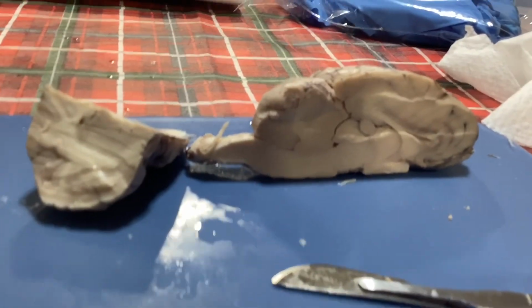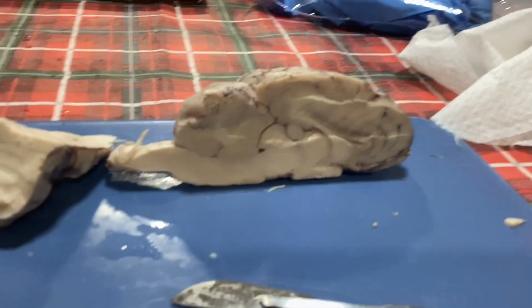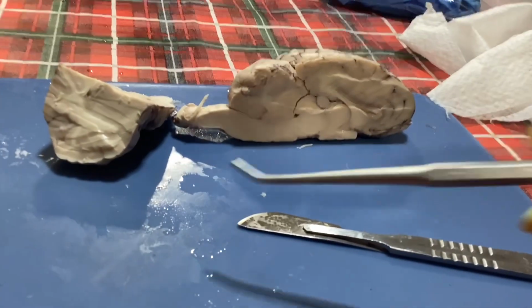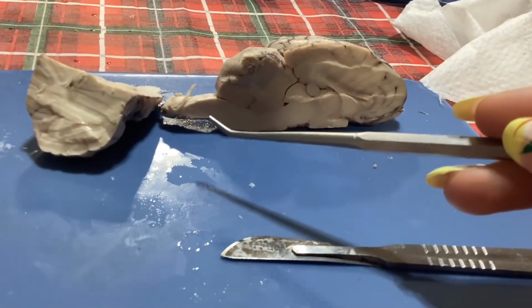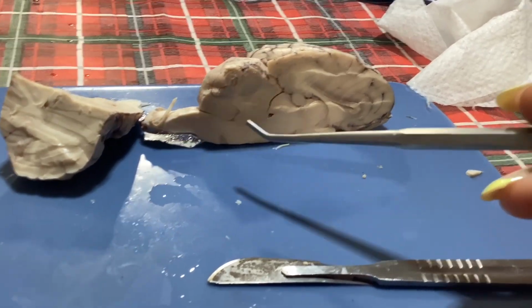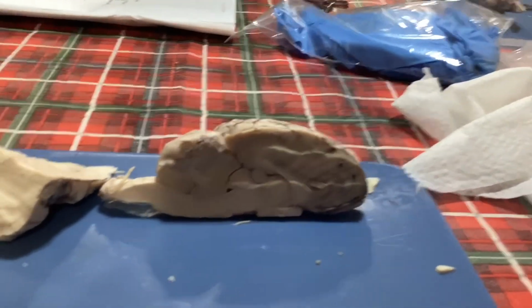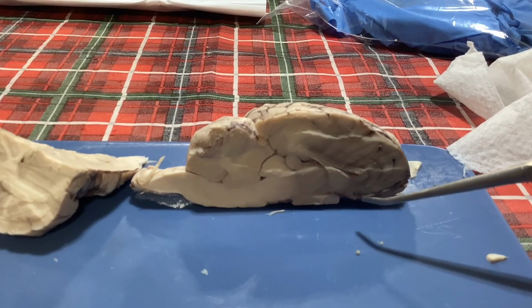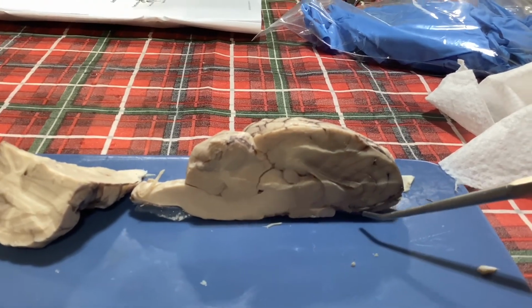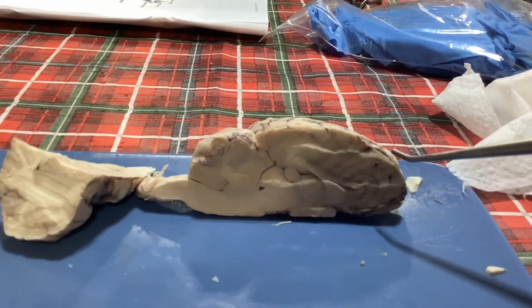Okay, and then like I mentioned earlier, there's going to be the hypothalamus right here. Just want to highlight. All right, so then we have the medulla, which is going to be over here after our spinal cord, and then you go into the pons, which is going to be this section right here, and if you go up a little bit more, this is going to be our entire midbrain section right after that. And then after all of that, we have the olfactory bulb, which is going to be right here at the bottom. If it was a little bit different, it would be popping out here, but it's going to be in this section right here.